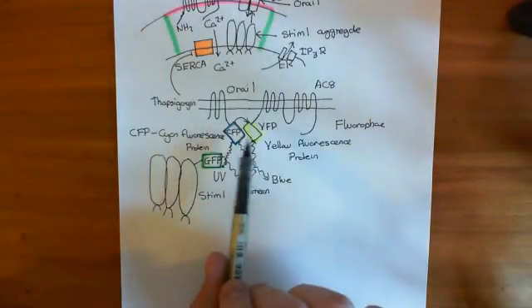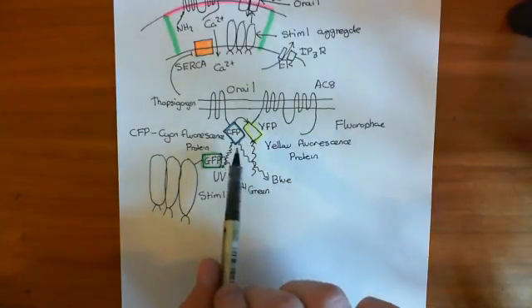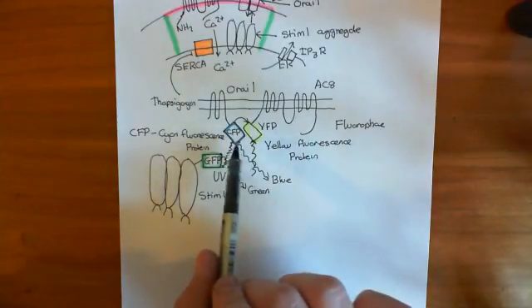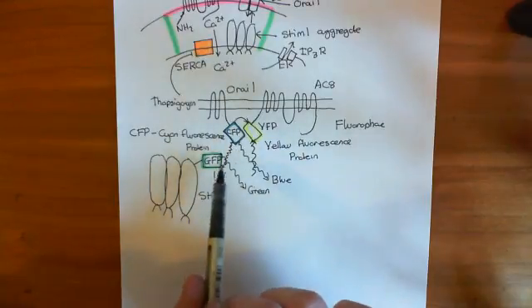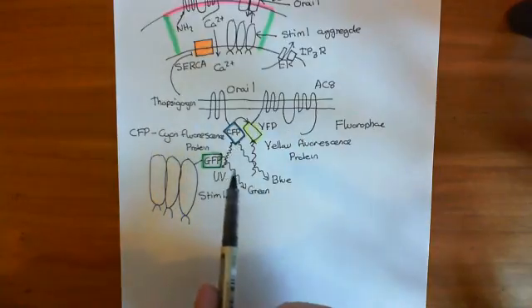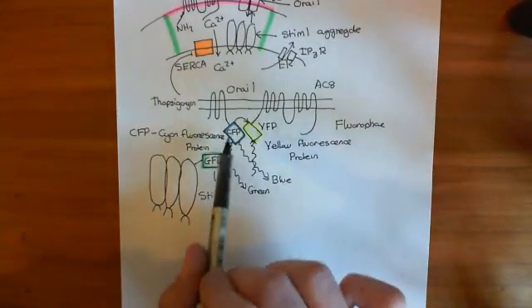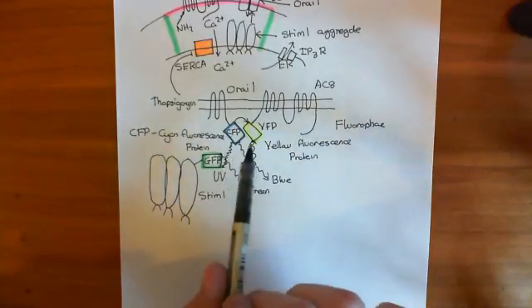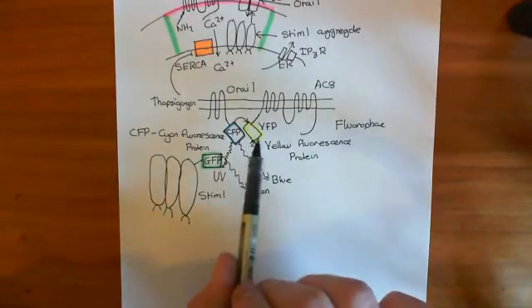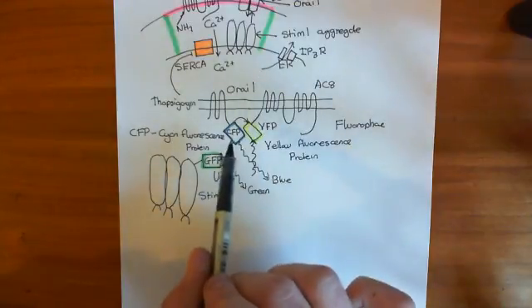These two different fluorescence proteins absorb UV light of different frequencies, so we can choose which fluorescence protein's UV frequency we want to use. We use the UV frequency that stimulates cyan fluorescence protein, and basically when we shine that frequency of UV light onto our experiment, we can analyse whether these two proteins are very close together.